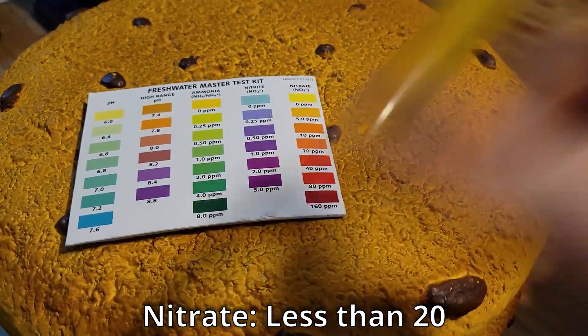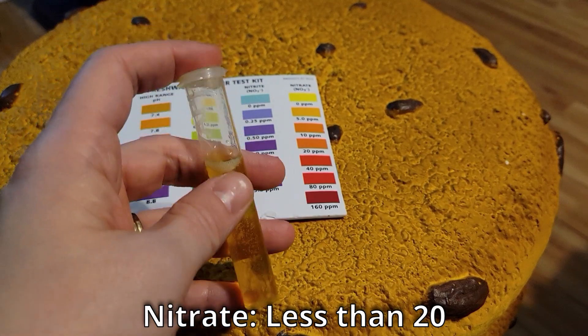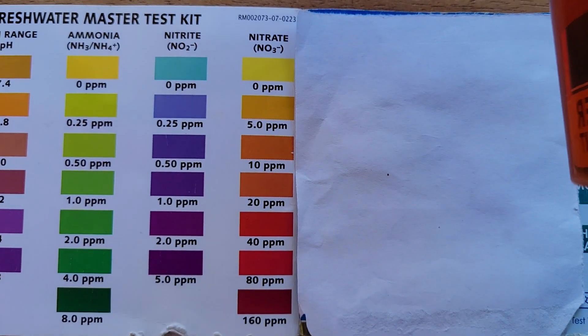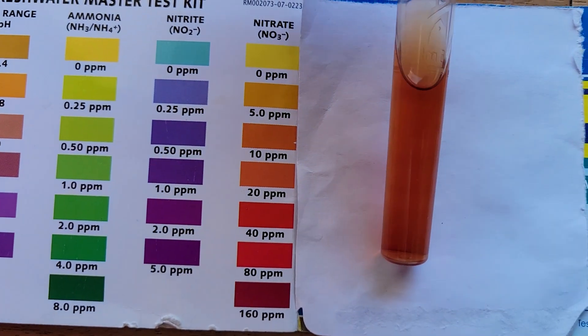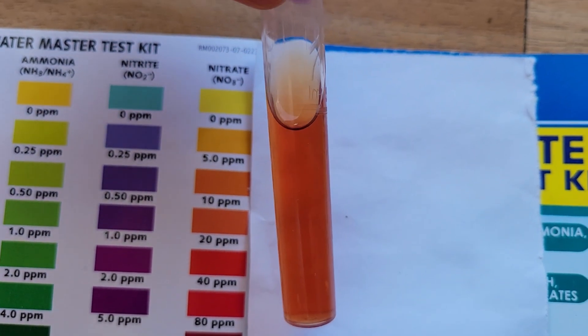There are crystals in the test bottle that need to be broken up in order for the test to be accurate. So it's very important for the bottle and the test tube to be shaken for the full 30 seconds and full minute.